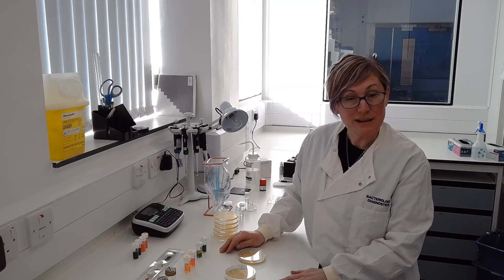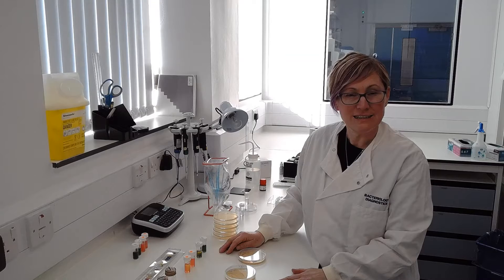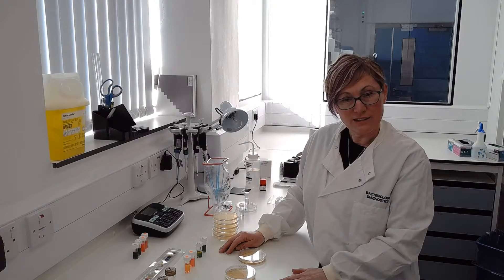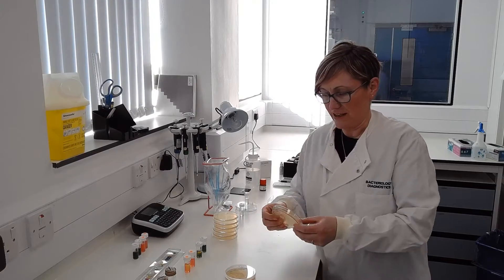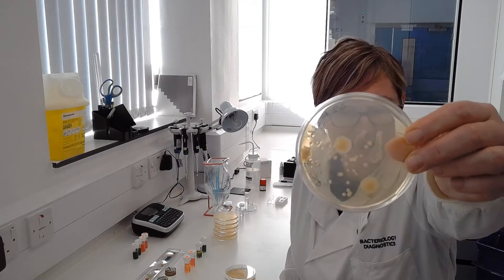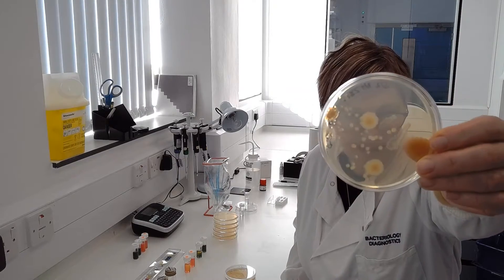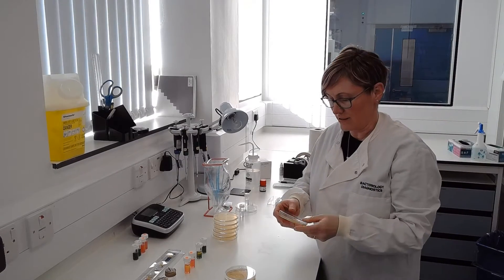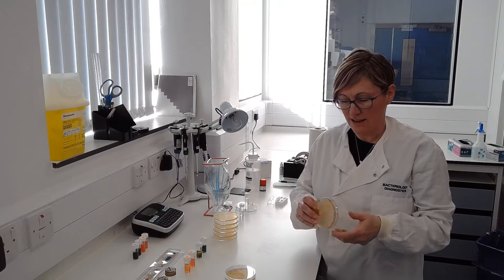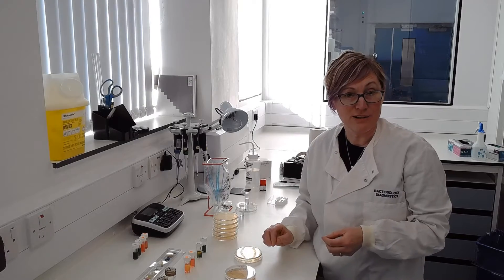When I get my samples in, they've been growing on agar plates for a couple of days. They've been taken out in the field by other inspectors. When I start to look at them, they look kind of like this — you can see various colours and sizes of bacterial colonies in dots. We have to pick out which ones we think are significant and purify them so that we can carry on and do our tests on them.